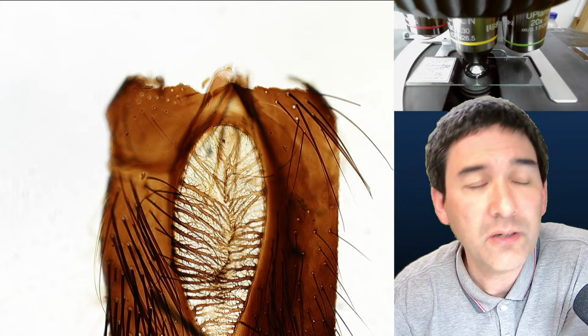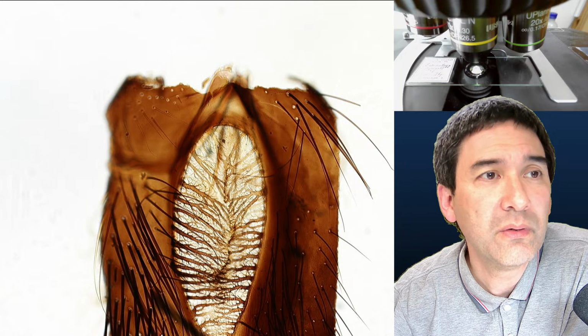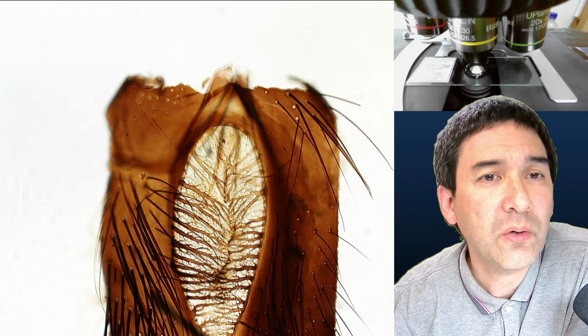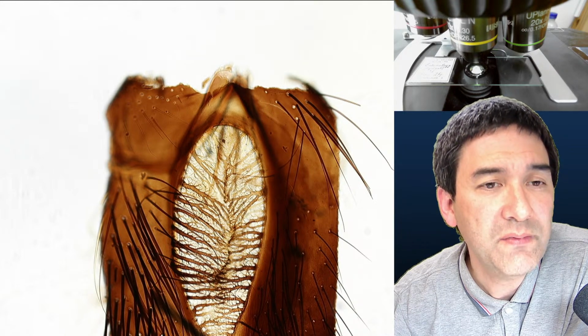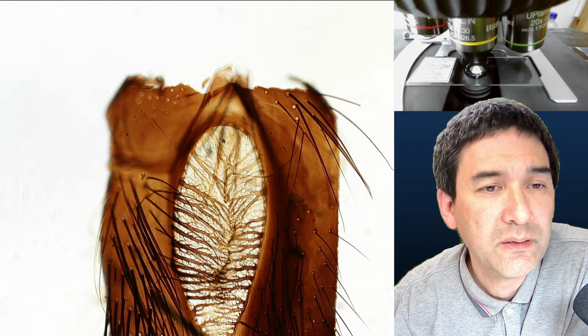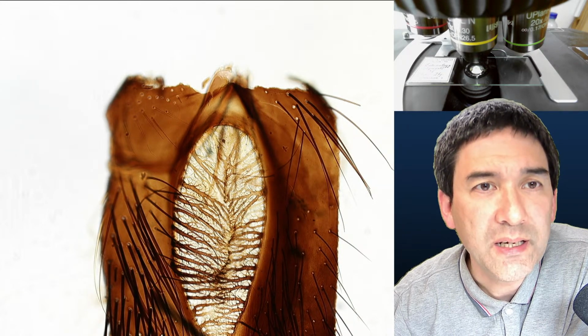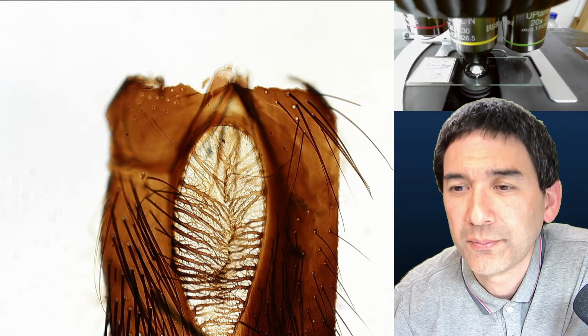Of course, you know what I'm going to do now. We go back here. We go into the import. We start, no, this one, not here. I click over here, video 4. Here, that's the video that I made. And I leave it at auto detect. I go to stitch. I wait again a minute or so.